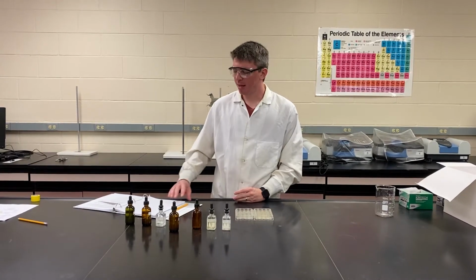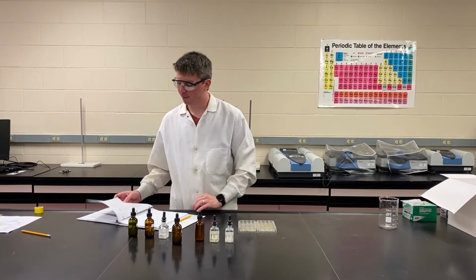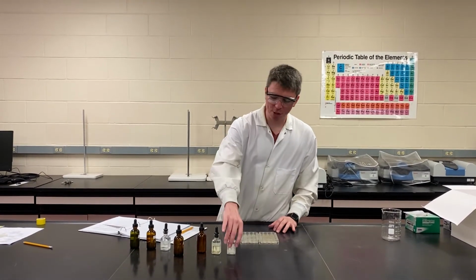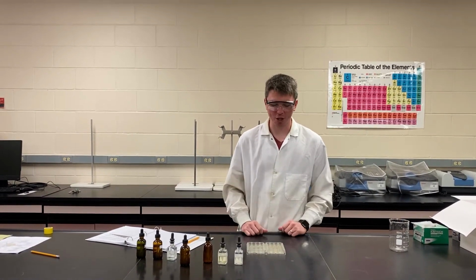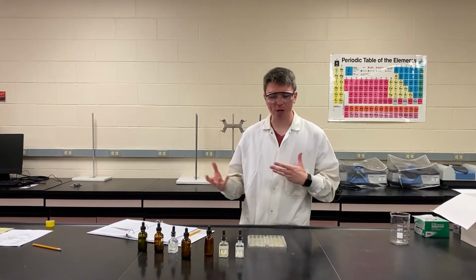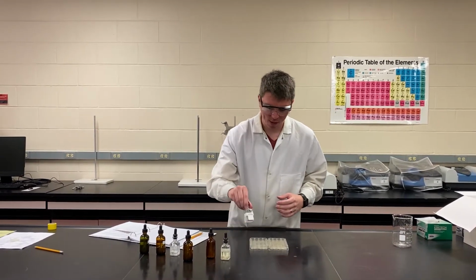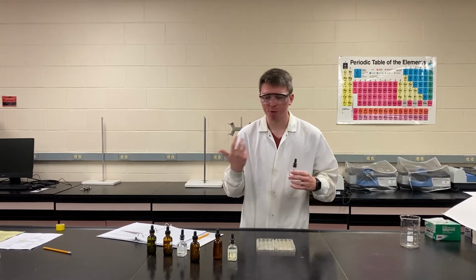So today we're doing an experiment on precipitation reactions and ionic solutions. What we're going to be doing is combining all of our known liquids together in various combinations, similar to what we've done for a handful of experiments in this course, and seeing which ones create reactions, especially those that form solids.